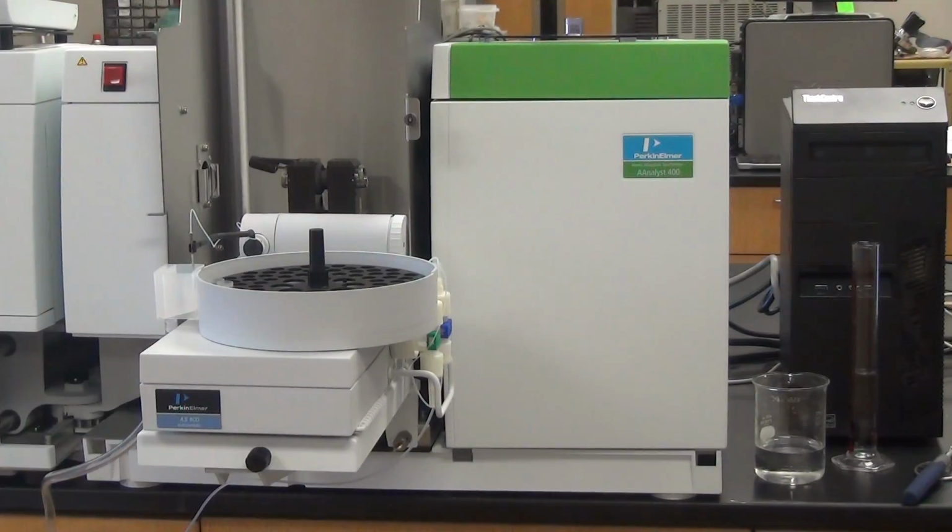I made it up right. I've got no idea. I got some more. It tells you a little bit about it. Diluent. There's no special remarks on this. But it's chrome. You probably, if you were running 1,000 selenium or arsenic or something, you'd have more comments to it.